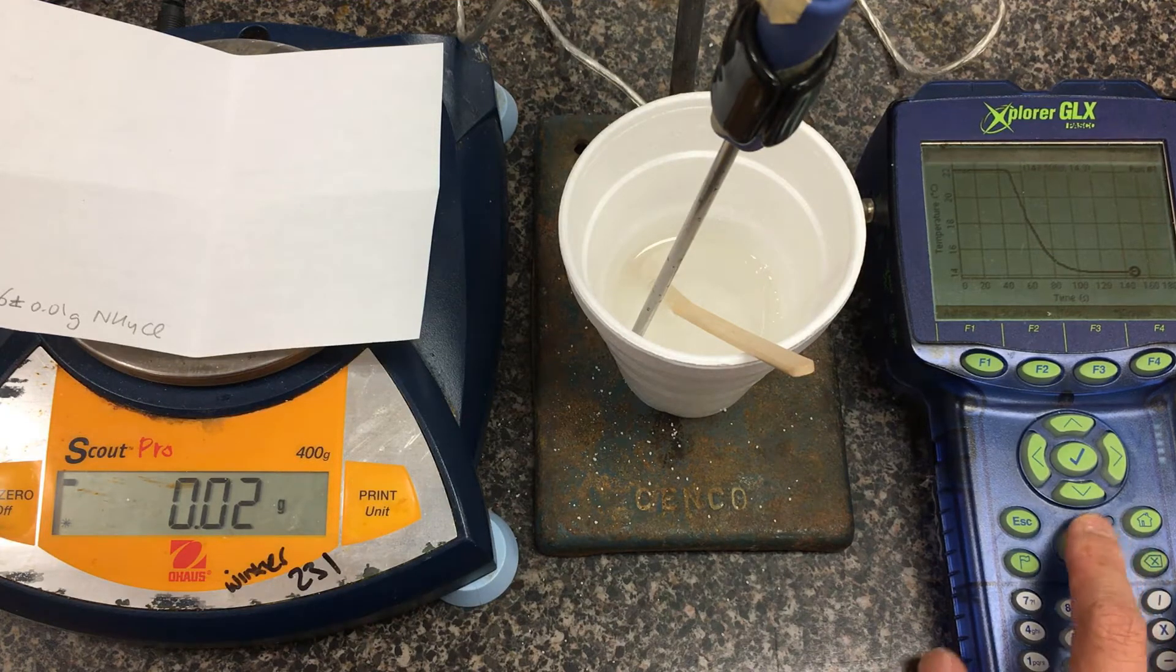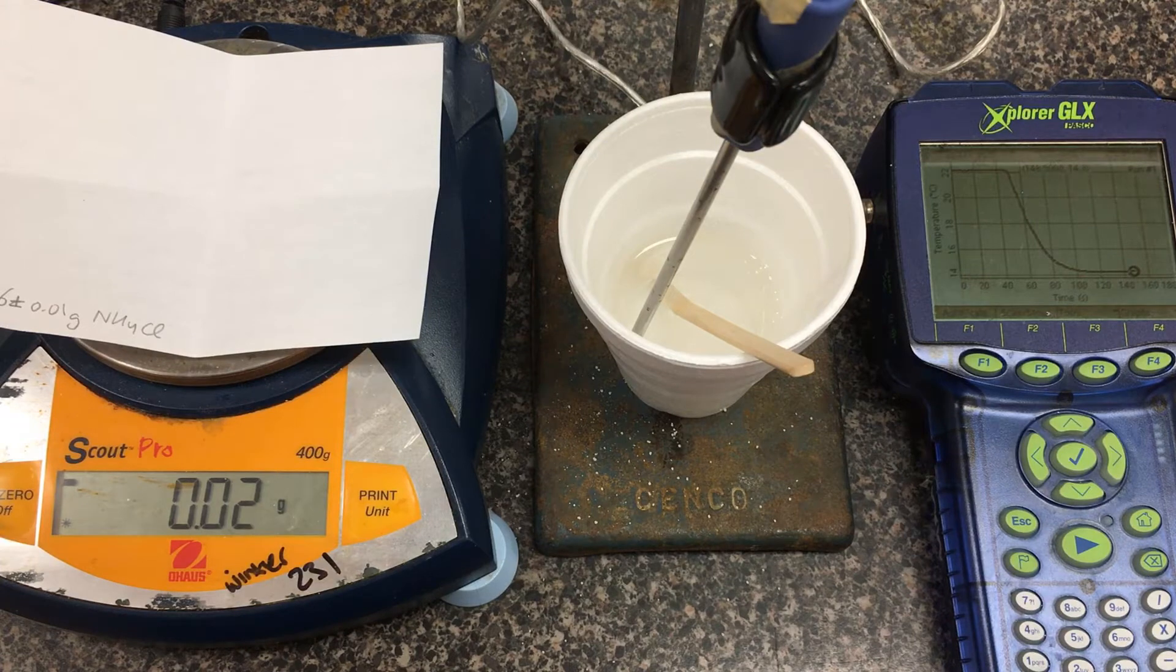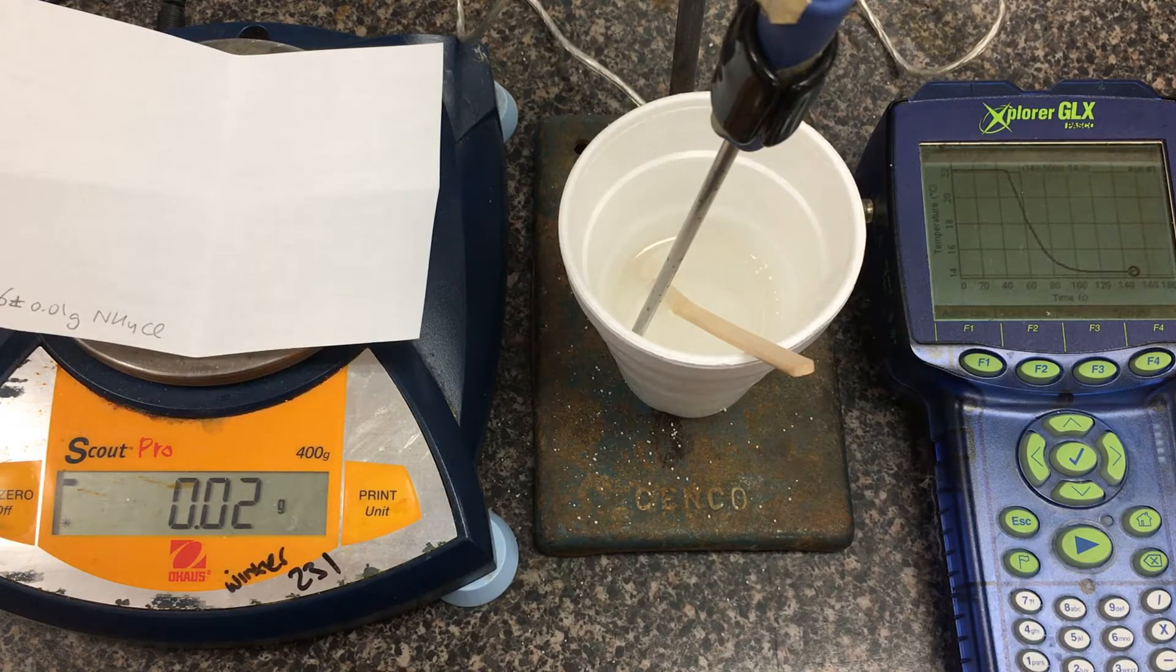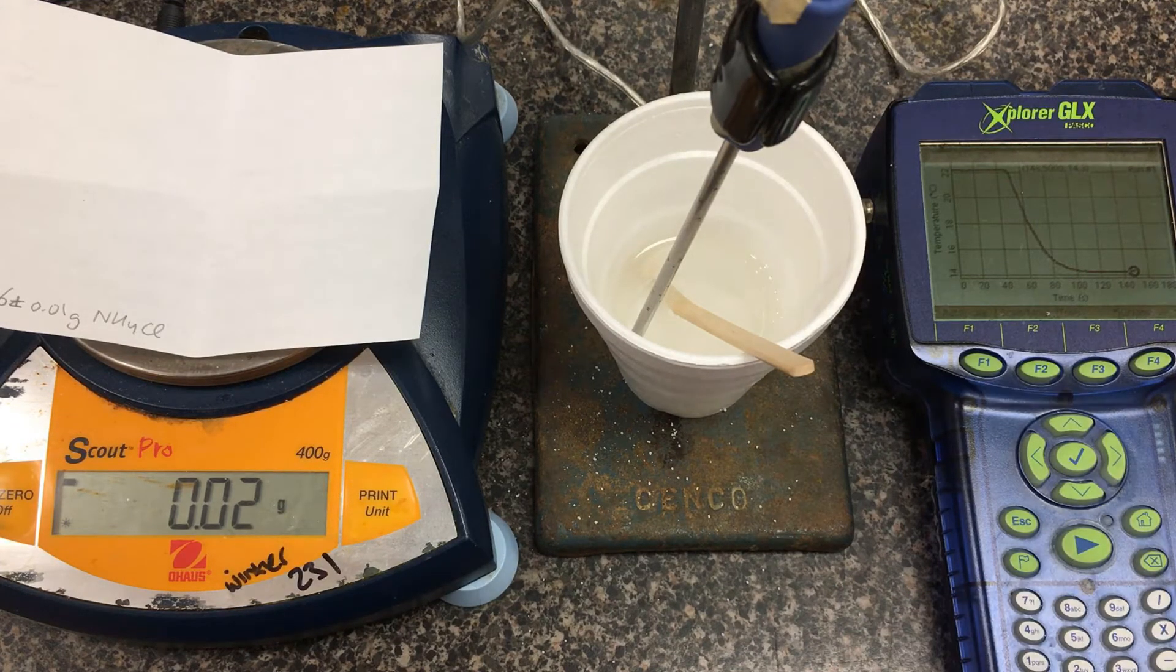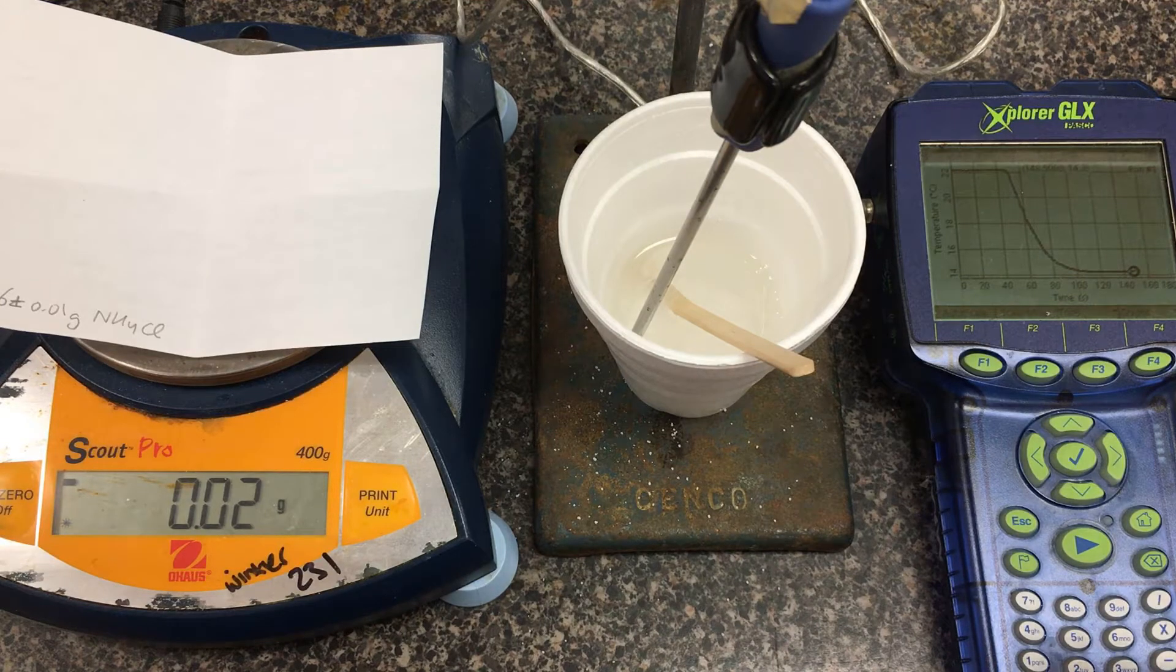When we're done with this run, we'll press the play button again to stop it. Then I'll set up for trial two, and we can export this data via USB and analyze it later.